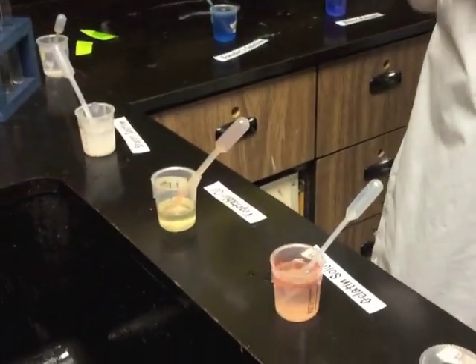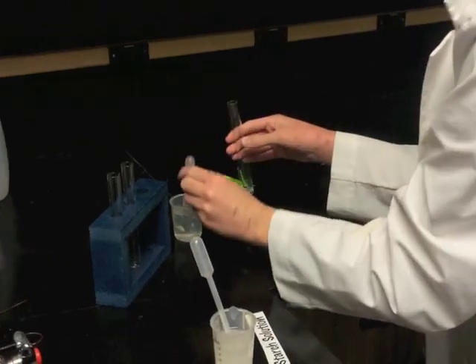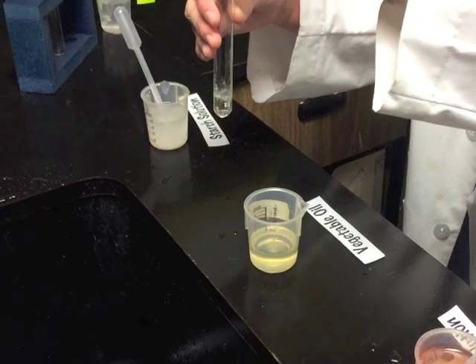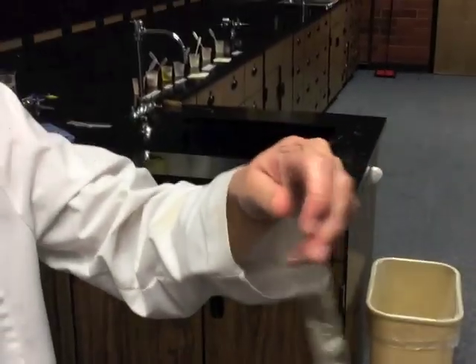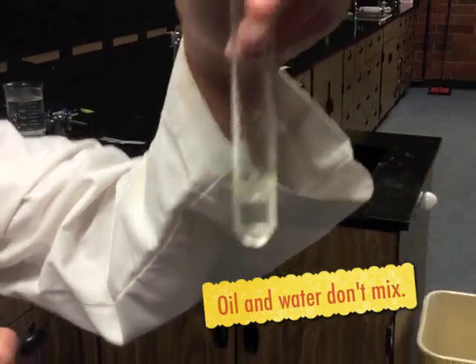Now add vegetable oil and water together in a tube. Add a little water, then add about the same amount of vegetable oil. Try to mix them together and stir as hard as you can — the vegetable oil and water will not mix.